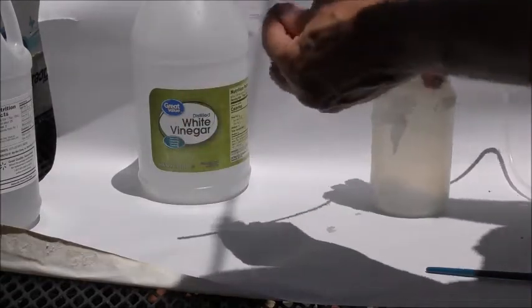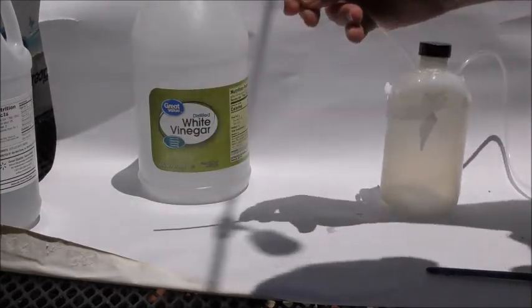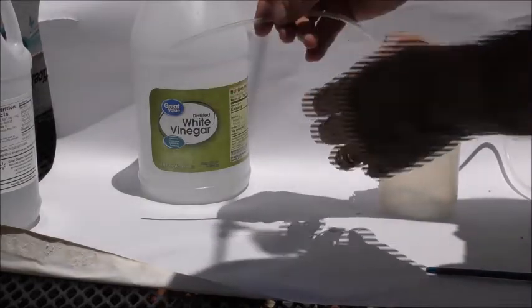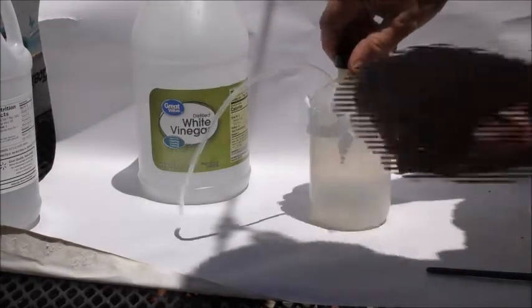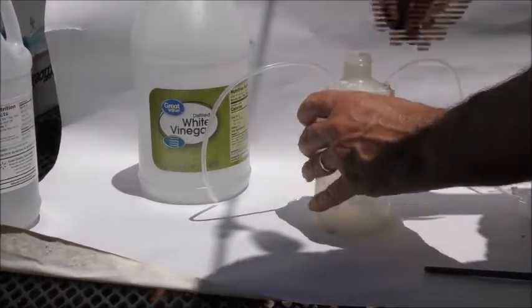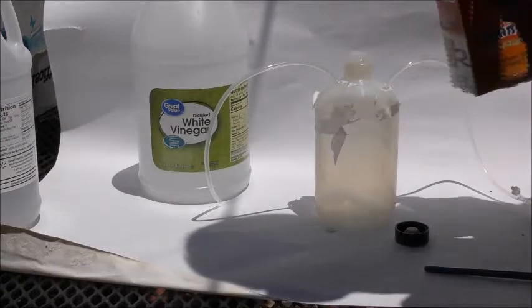And then this is really nice because it's narrow enough to fit down in the tube for your flies and you won't have escape around the edge. So what we're going to do now is put some baking soda in there.